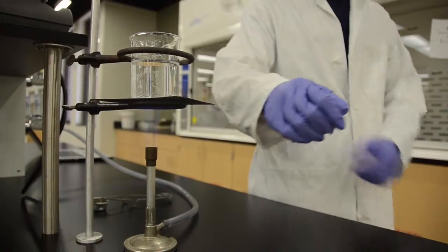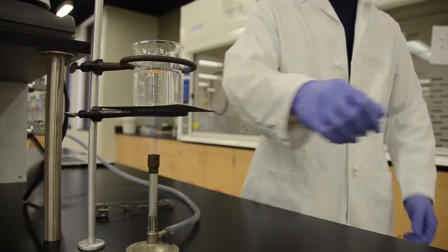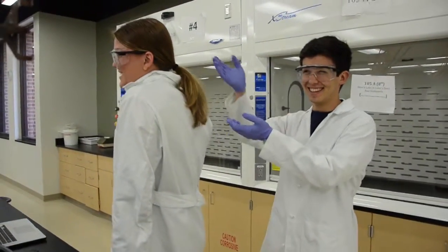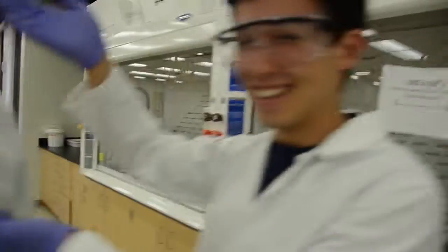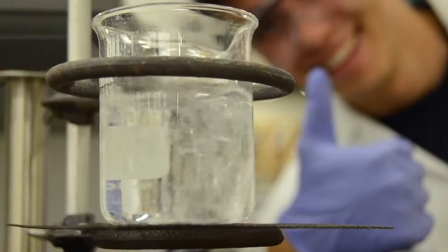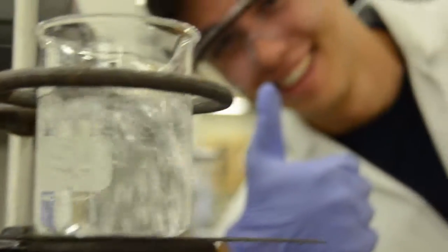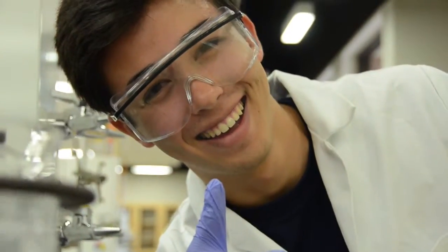Some cautions include making sure that loose articles of clothing aren't held around the open flame. For girls, make sure that your hair is tied in such a way that the open flame won't be able to burn it. Typically, a ponytail or bun should accomplish this. Last, keep paper and other flammable materials, including other chemicals, away from the Bunsen burner.